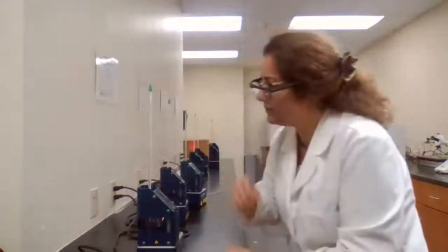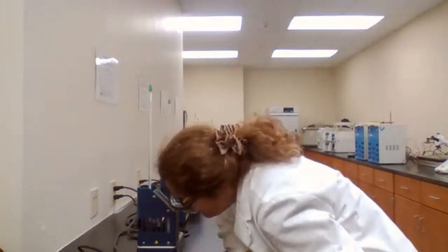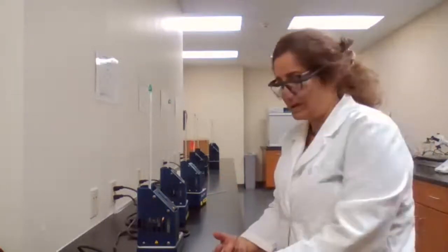Do you have the melting point for dimethoxybenzene? The theoretical value? If not, can you check it? Because if we have the theoretical value, we can find out if the sample has been purified properly or not.